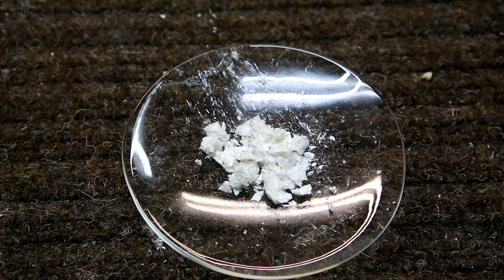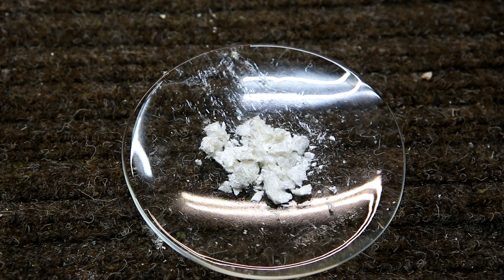After recrystallizing, filtering and drying, I was left with about 0.4 grams of nice white vanillin crystals.